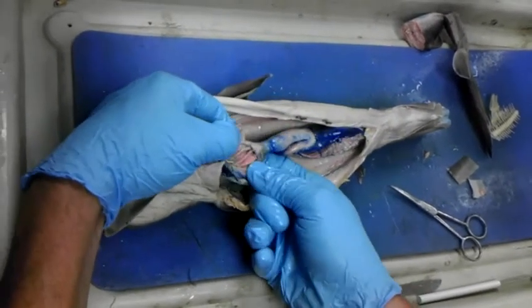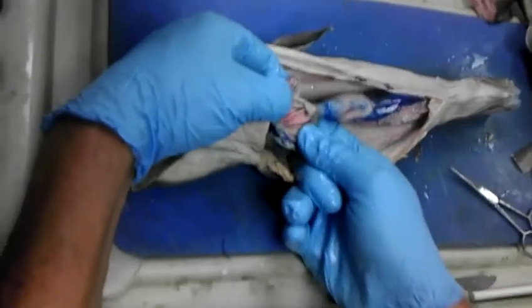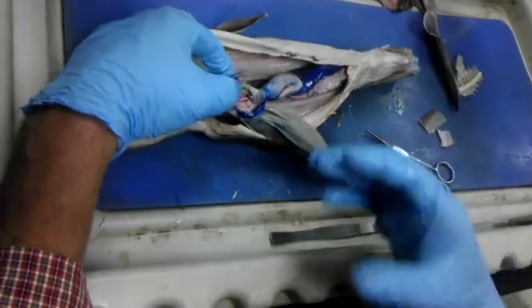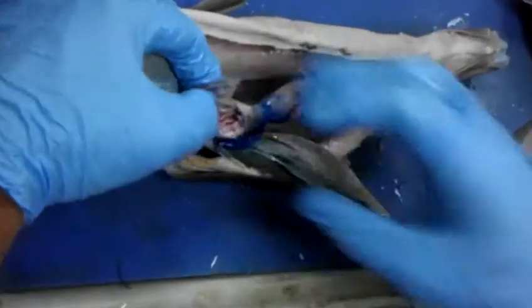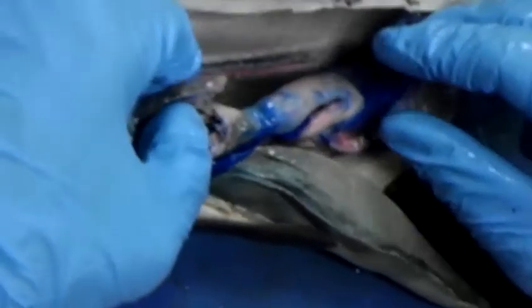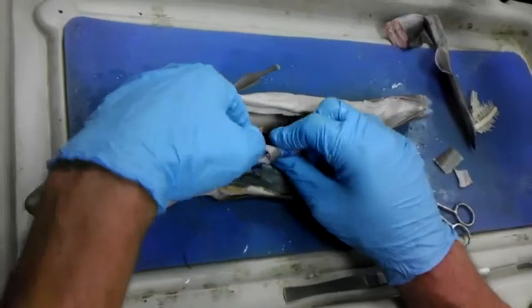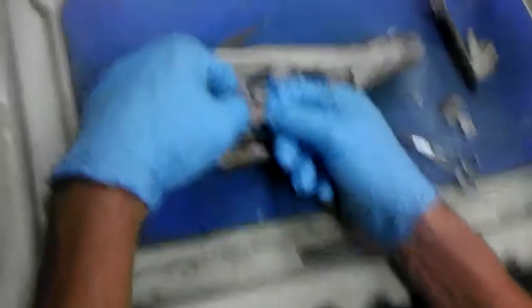That's called rugae, and the rugae allow the stomach to expand out. If you eat Thanksgiving dinner, eat a little bit too much, it really expands. And we've cut open fish at tournaments before and had fish that big and the fish about this big, now all inside that stomach. Very normal. They weren't cheating, we don't think.